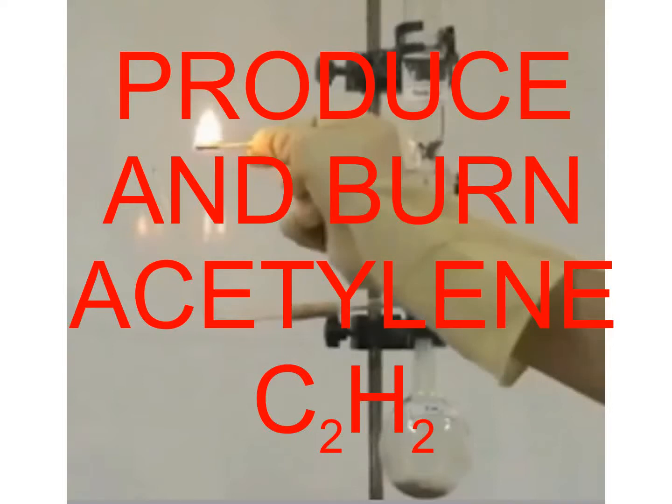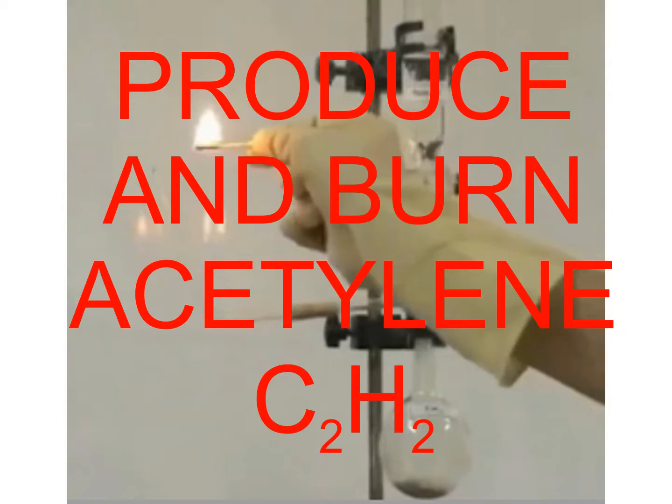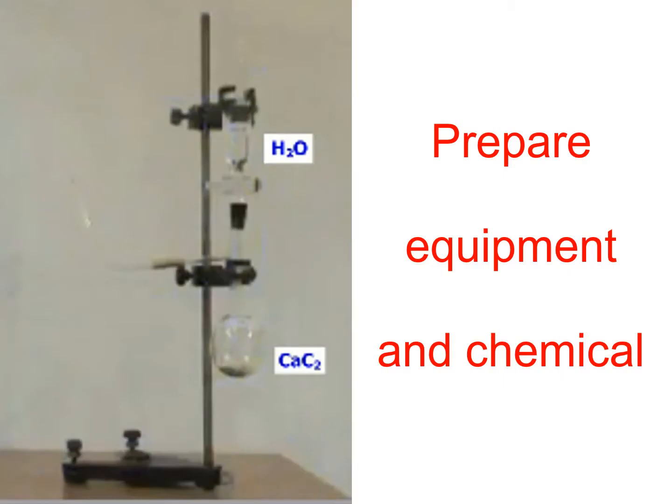Welcome to Emily Chemistry Aerobic Channel. Produce and Burn Acetylene: prepare equipment and chemicals.